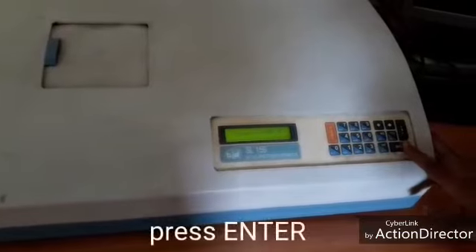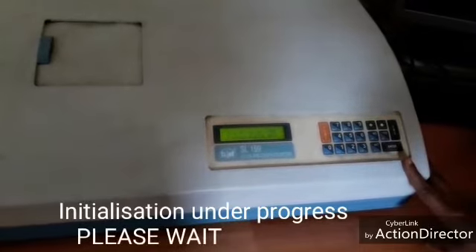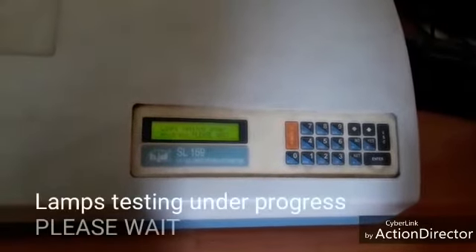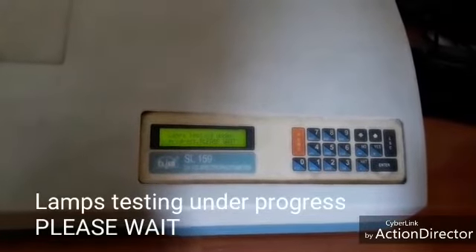And then press enter. Initialization under progress. Please wait some time. Lamps testing under progress. Please wait some time.